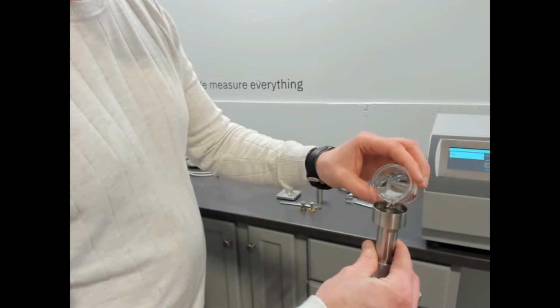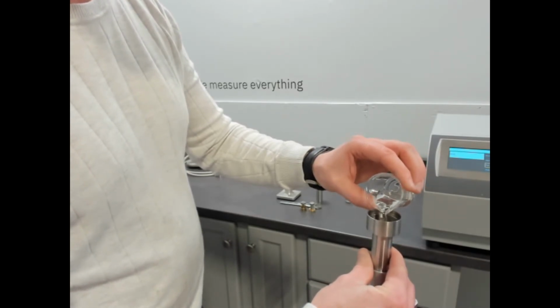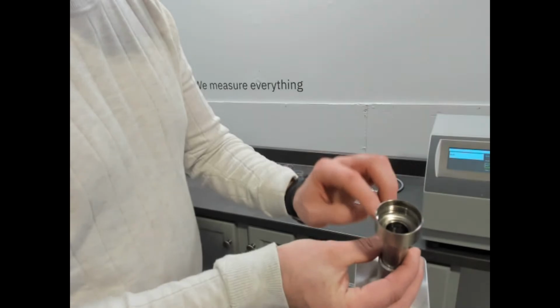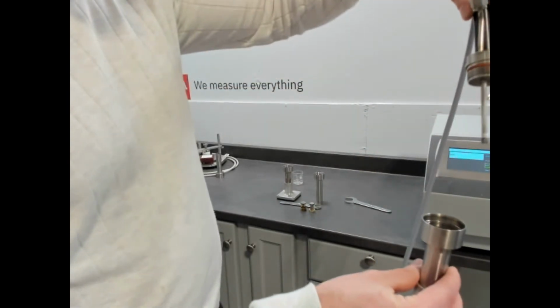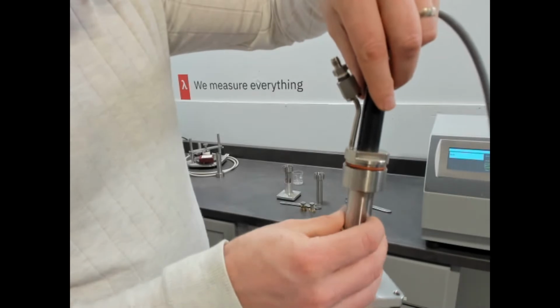So I'm just putting in water. It'll be hard for me to show this because it'll just spill out, but I'll try. So essentially, you can see the fluid in there. That's about 20 milliliters. And then we would insert our sensor, and turn it.